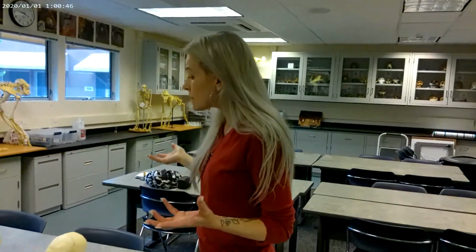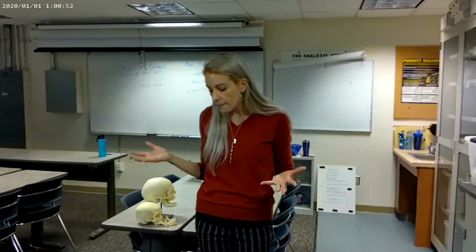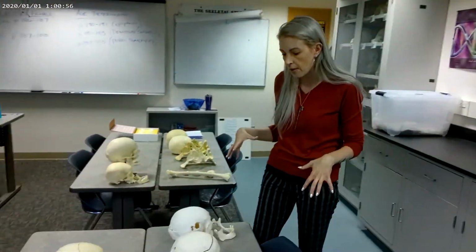So you can look at sutures as well. If they're hard to see, that's an older age. If they're very clear, that's a younger age. Last thing is just kind of more for fun. You have a little bit of pathology, but I also do like a nice extra credit. So I like to go through some of these skulls and just kind of show you some of the pathology.